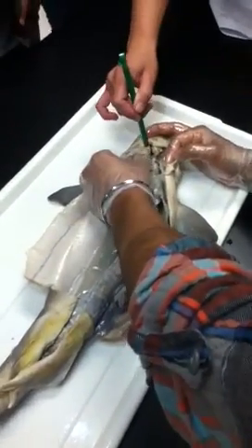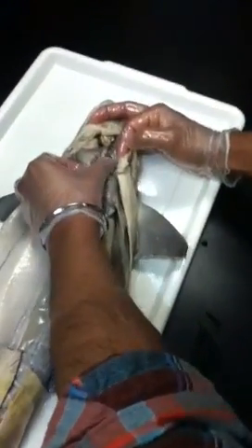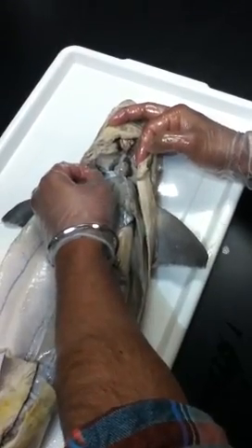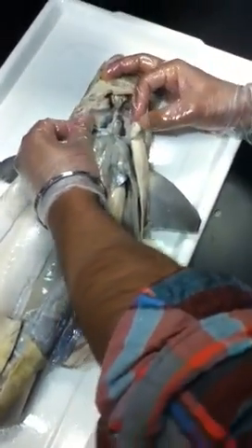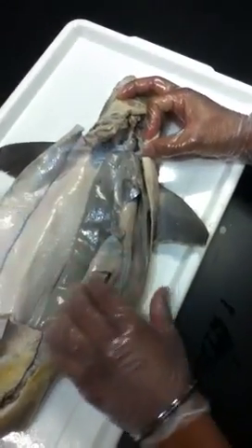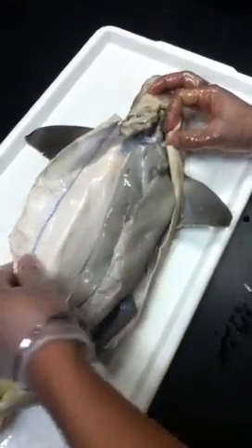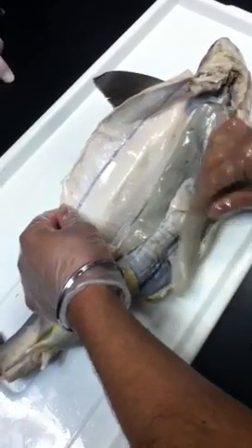The darker black thing is the atrium, and the ventricle is in the middle over here. And then what is the structure coming off of the ventricle? That's the aorta. There we go. This is the aorta right over here. The light line goes to the ventricle. The aorta is connected to the ventricle. The atrium is the dark black looking thing, like little lumpy sacks. And the blue thing over here is the vein, basically.